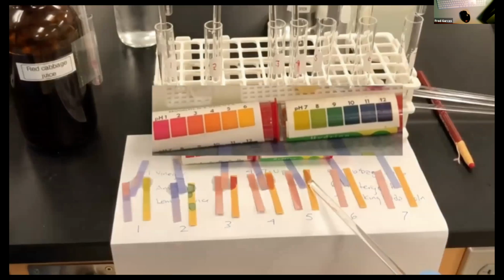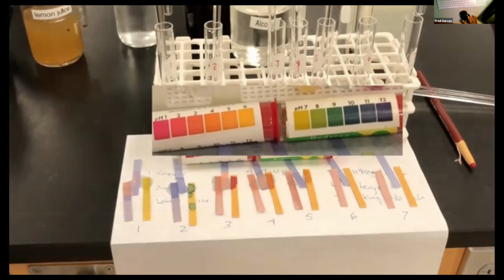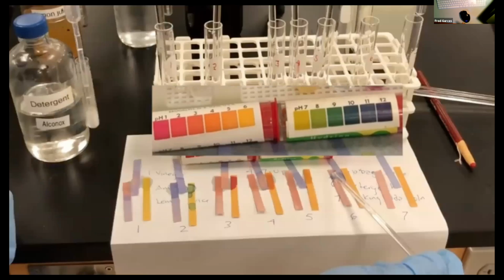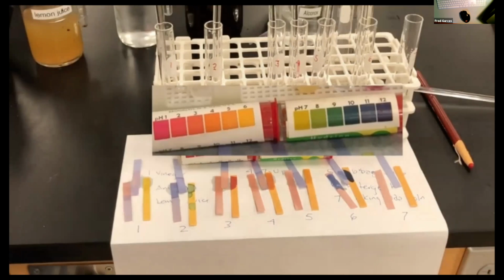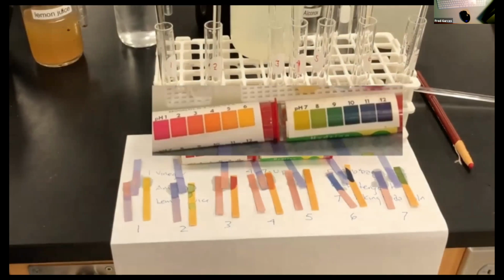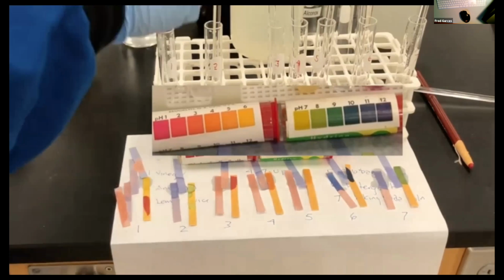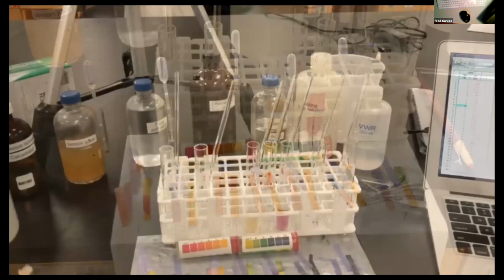Now you could pretty much estimate just based on the litmus paper. Notice that there is red litmus and blue litmus, and then hydrion. Red litmus and blue litmus will tell you whether it's acidic or basic, and then the hydrion will tell you approximately what the pH is. So I go through all 7 solutions. Now just based on the color, you should give an estimate of what the pH is for each one of these. First one is vinegar, second one's ammonia, third one is lemon juice, fourth one is 7-Up, fifth one, well, you can see that.